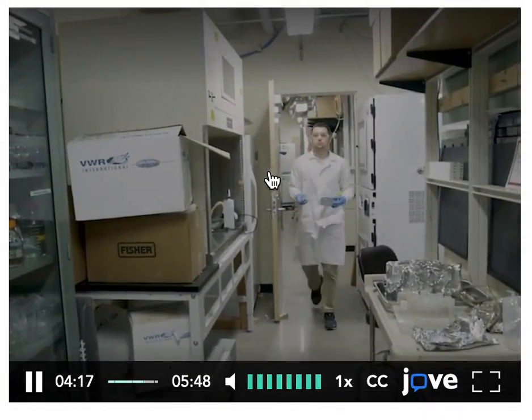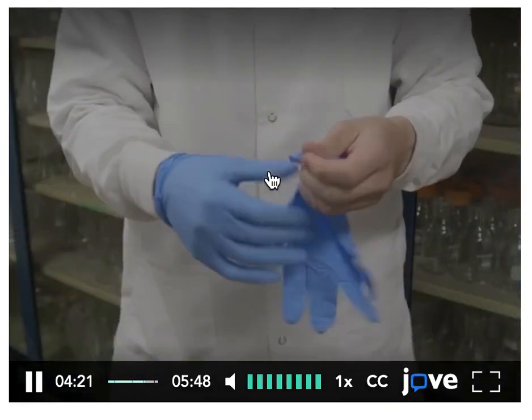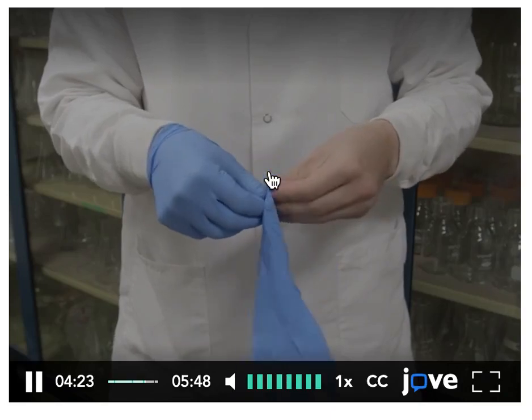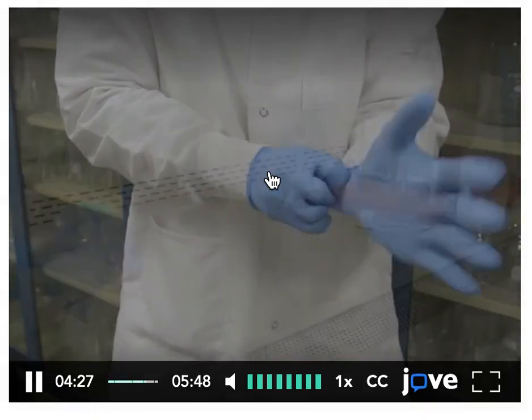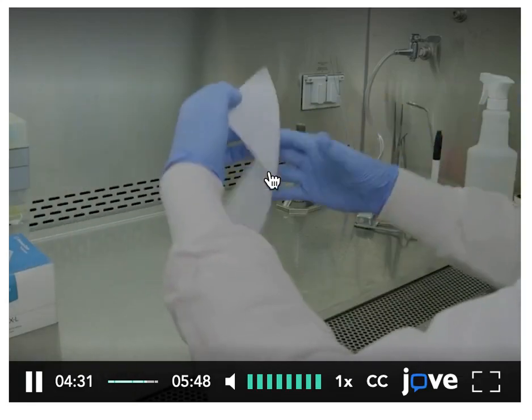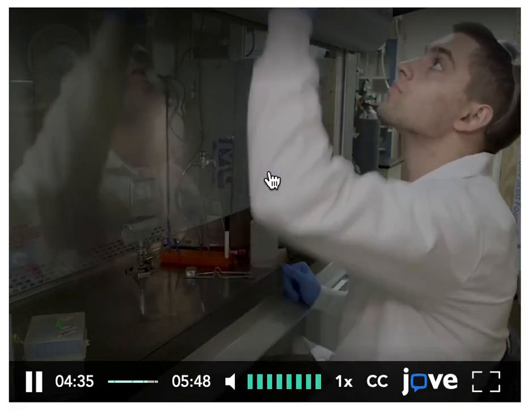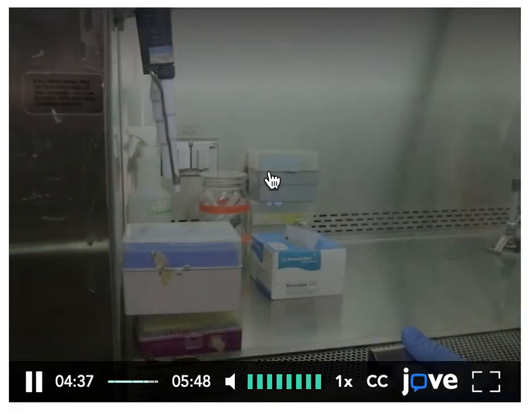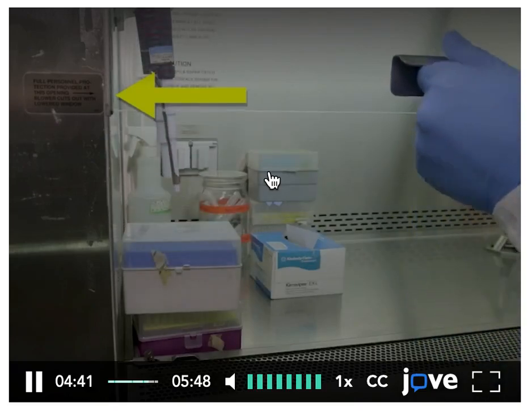Laminar flow cabinets are commonly used in places where contamination is a concern, like a biology laboratory, so you will need to be careful of contamination by yourself and laboratory air. To prevent contamination, use ethanol to sterilize gloves and any equipment before using the cabinet or opening the sash. Make sure the sash is not above the maximum allowed height to ensure a sufficient flow of air.